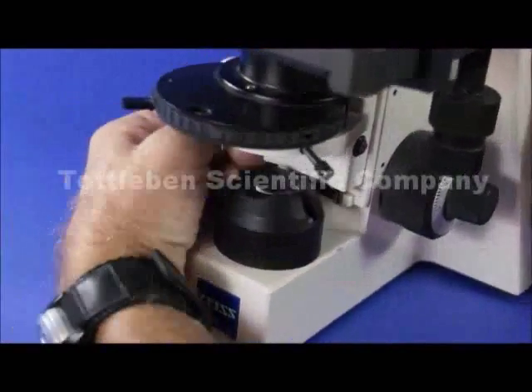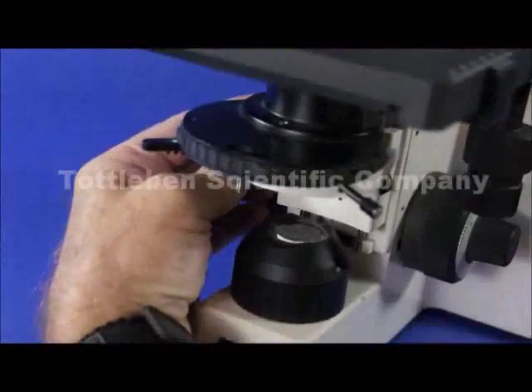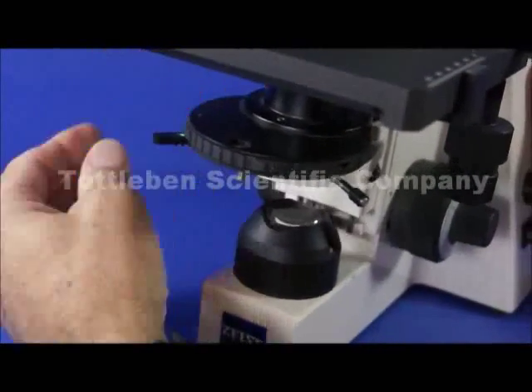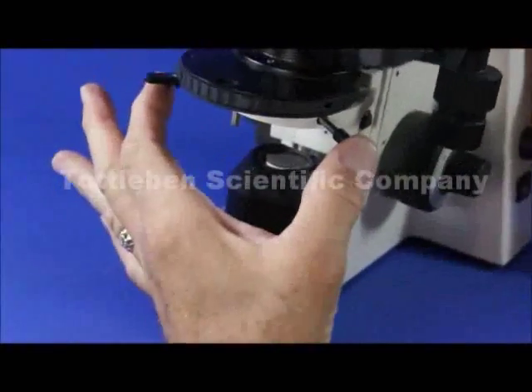Right here you have a phase condenser. It's both focusable as you can see and centrable with the centering screws in the very front.